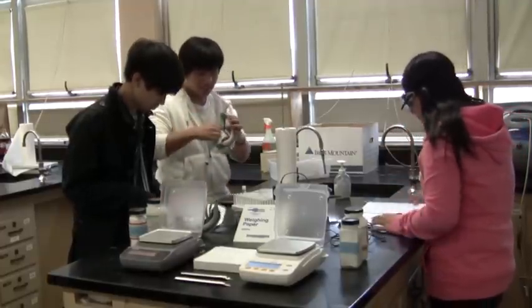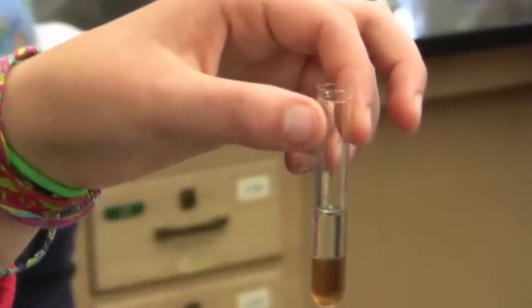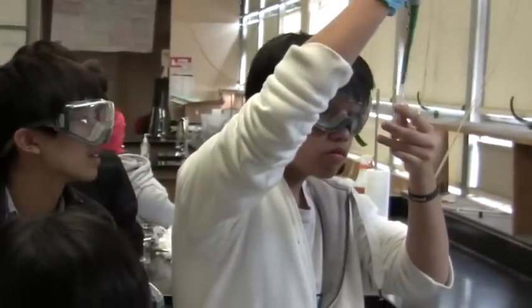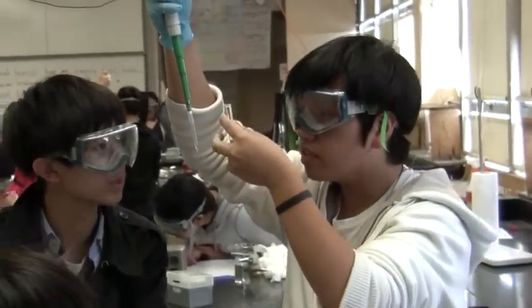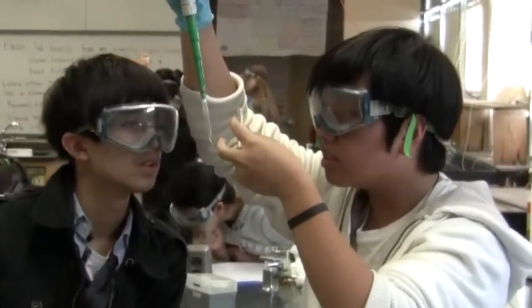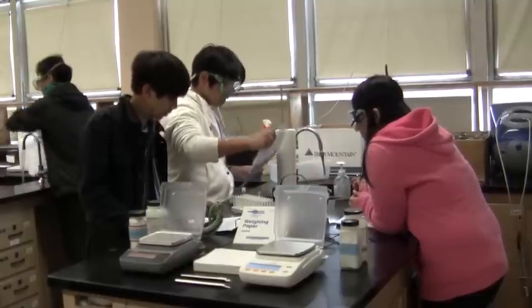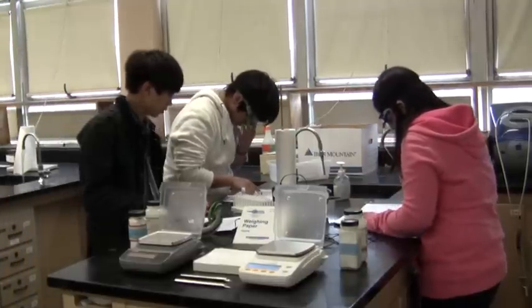I was kind of surprised that when you were supposed to pipette the top layer of the solution to get the caffeine out, it's not just the top layer — the brown tint which was the caffeine — but also all the isopropyl alcohol that was added. So you have to account for the minute amounts that didn't flow to the top. It had a sense of urgency not present in our previous labs because we knew we had to make it as accurate as possible since we were actually sending it to a real lab for analysis.